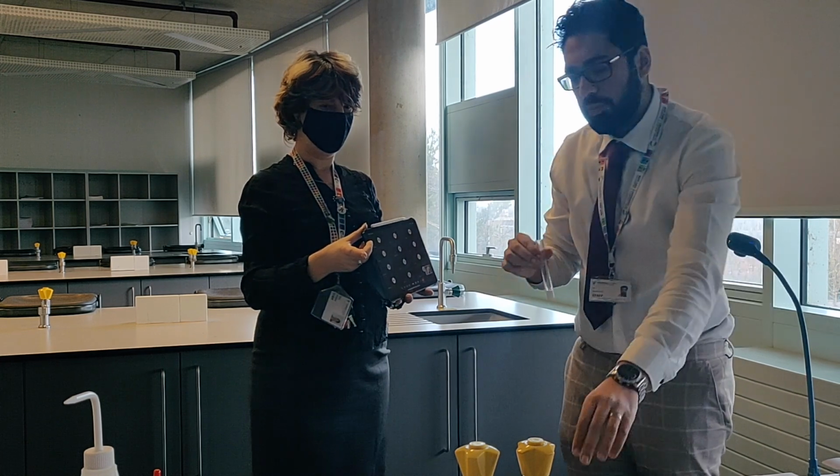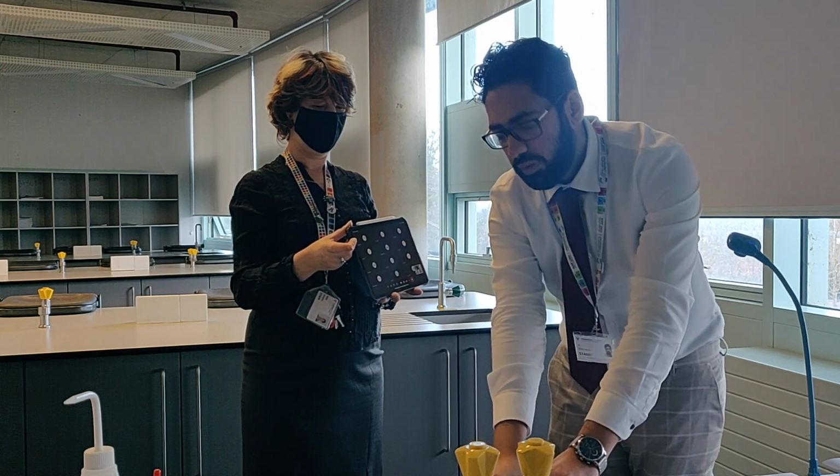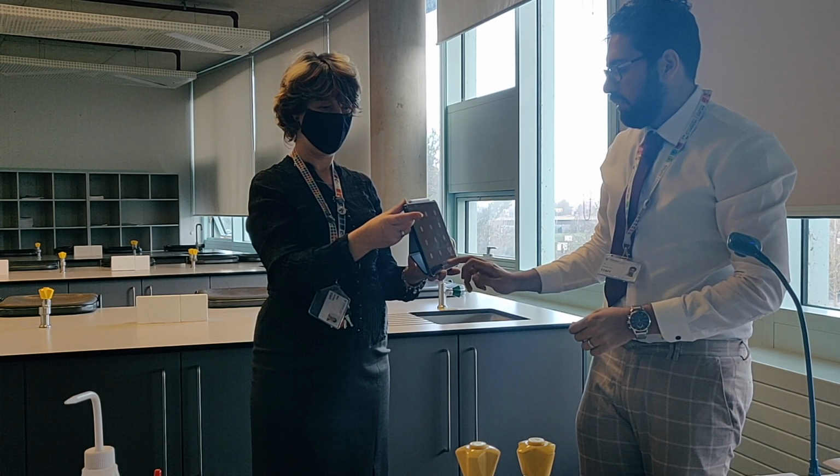And I'm going to just dispose of it in the disposable beaker. And then give us again 1 minute to set up test 7.